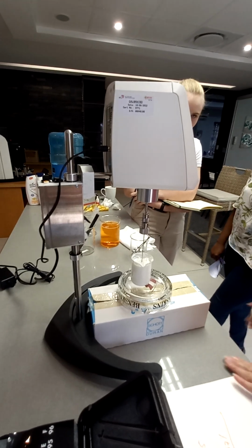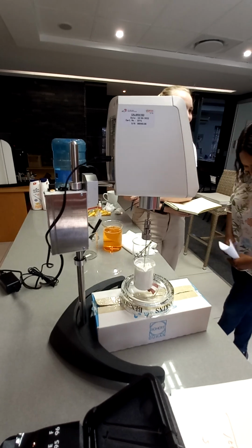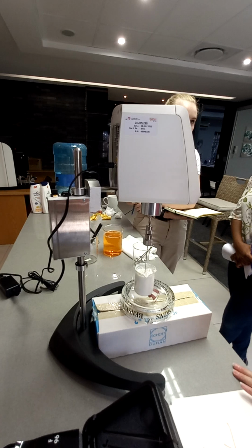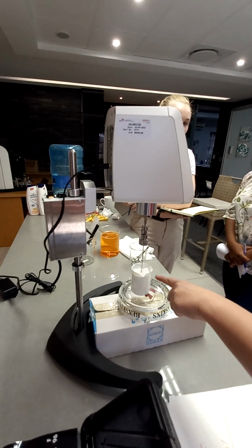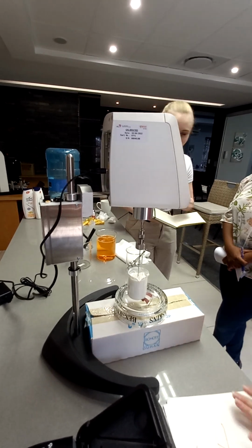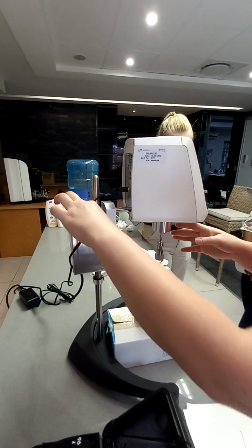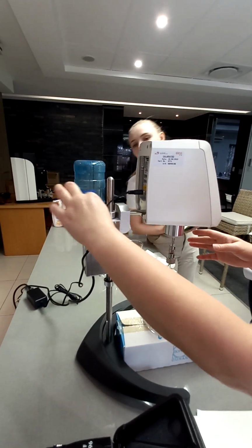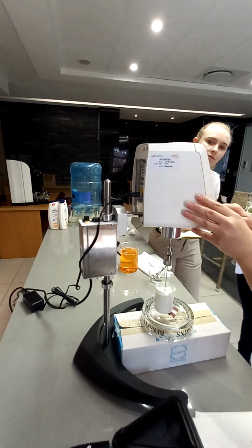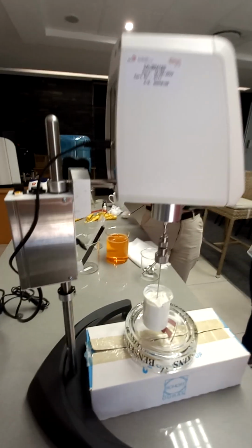We've got customers, I know one side, they don't even use the up and down, they just rotate in one spot. Really? Yeah, and then they move it down and get stable readings, because it would be maybe a little bit thinner, so it closes up quickly. Okay, and then the motor also has a button to run it. So you want to start here first. We're going to switch the motor on. So you can see it's running.